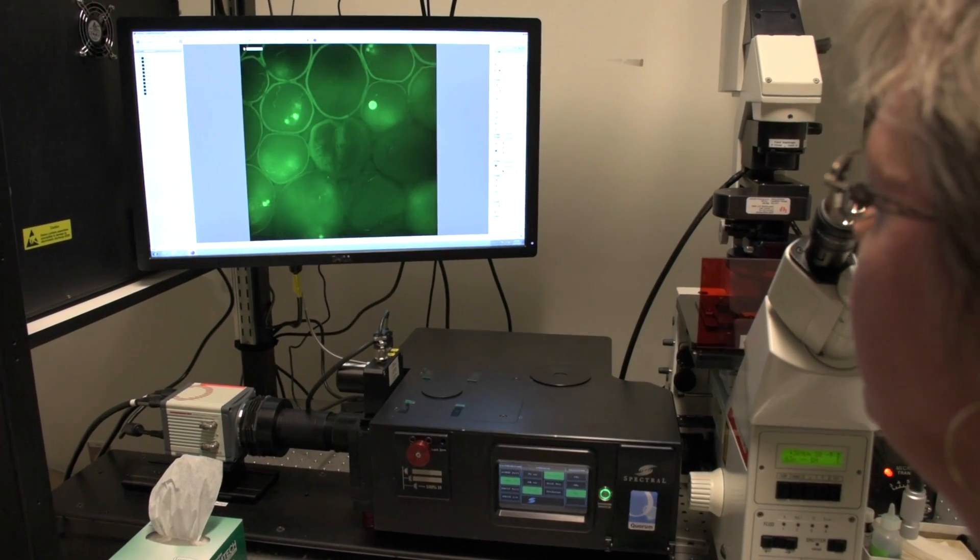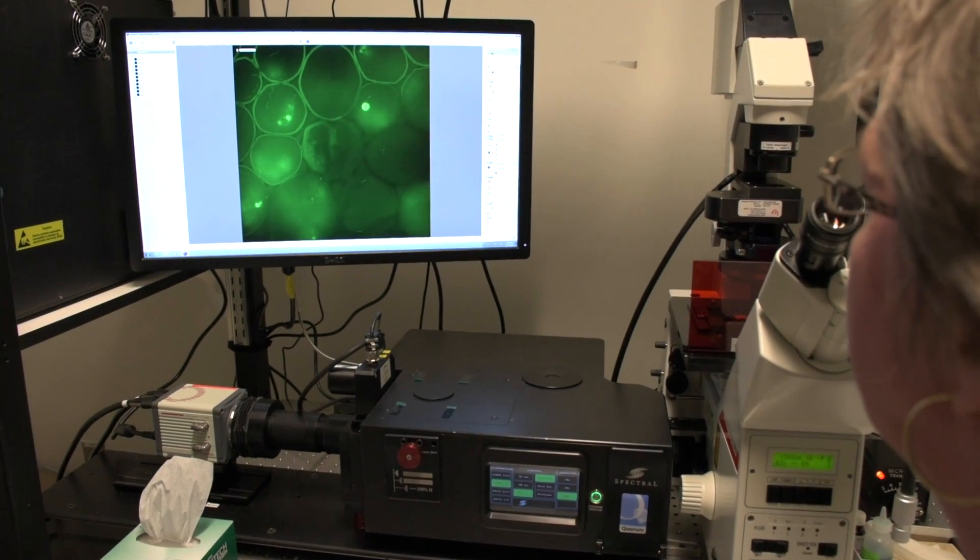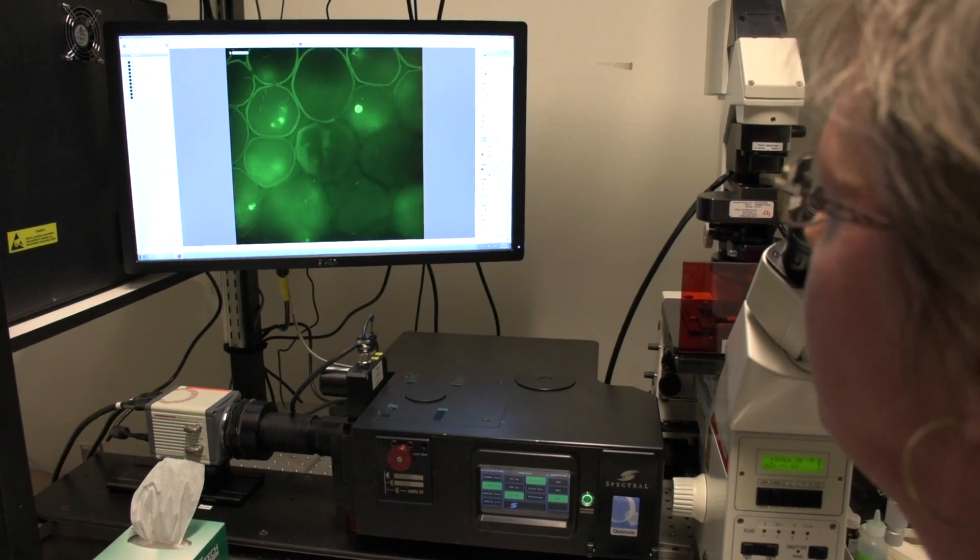Biology isn't static. Still pictures give us a snapshot of what we're looking at. But again, if a picture's worth a thousand words, a movie's worth a million words. And we can really understand more as we look down that temporal timescale to understand what's happening within a cell.